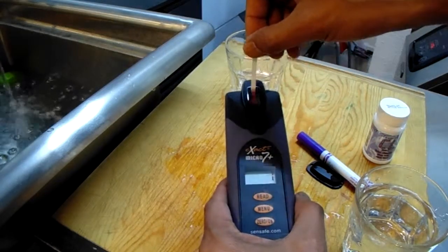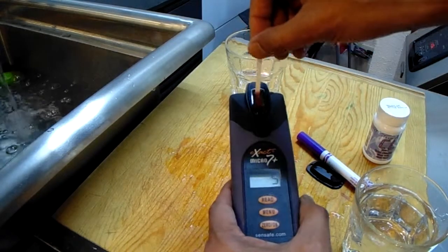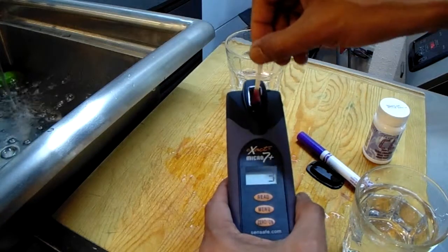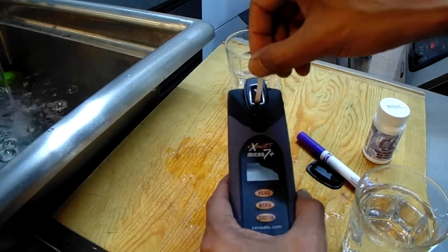And if you want to see if there's ozone in the water without a measurement, you can look at my other video on seeing ozone in water.